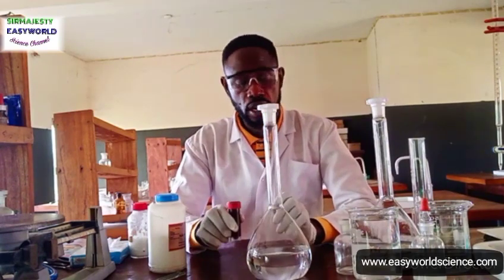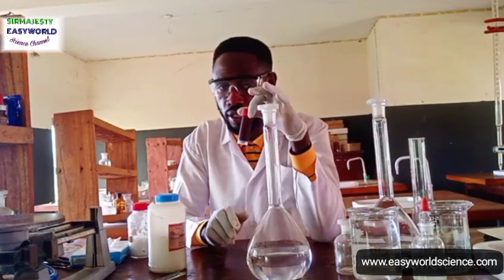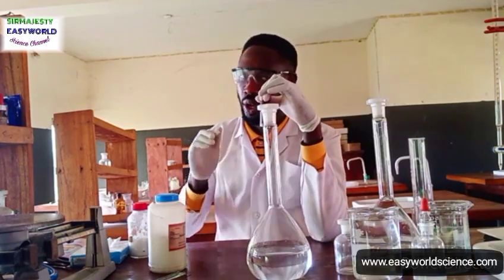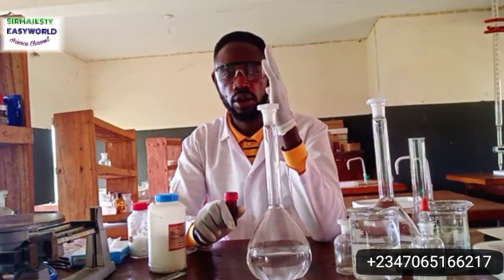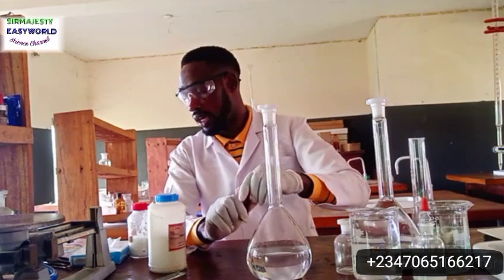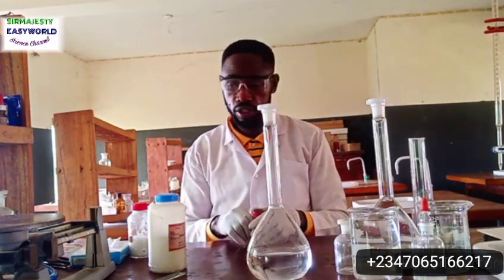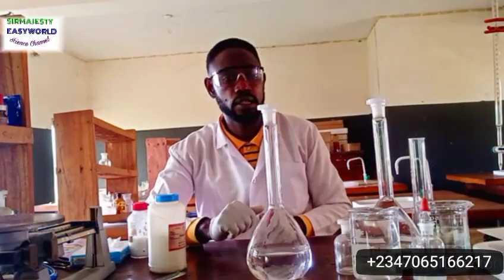and keep it away from your students. Now, what did I say we do? We add the iodine crystal. I've measured this already. Remember, you have to measure according to the instruction. You have to measure according to the instructions. They said 25.4. I didn't even use this weighing balance actually. I used electronic weighing balance.